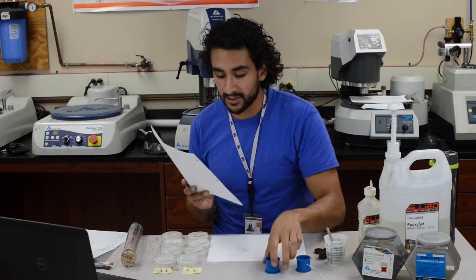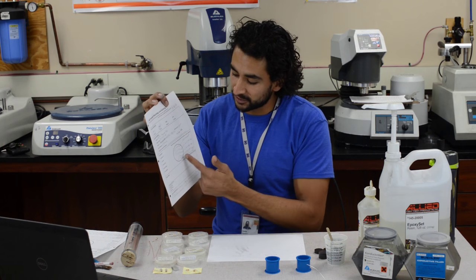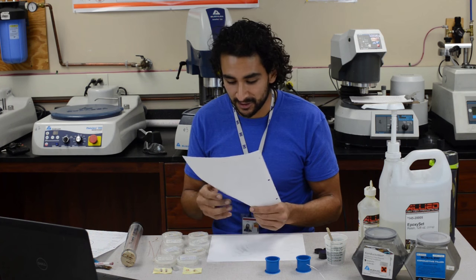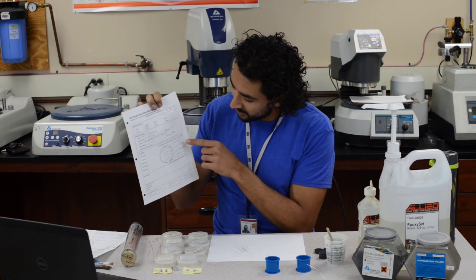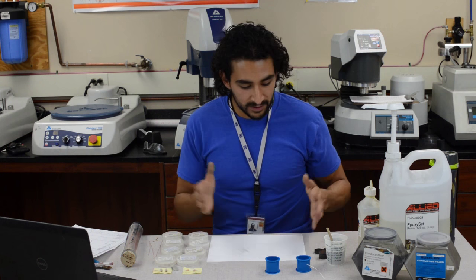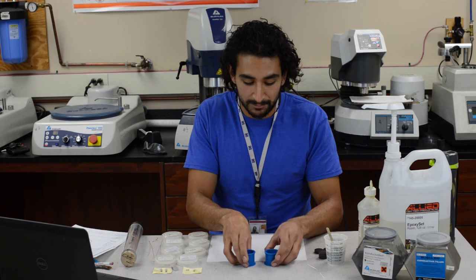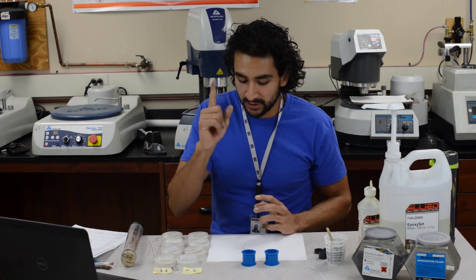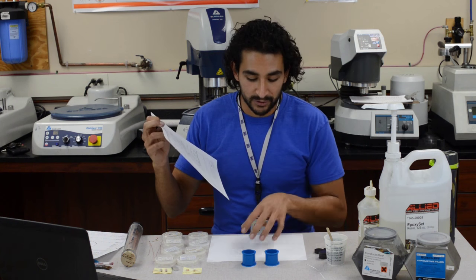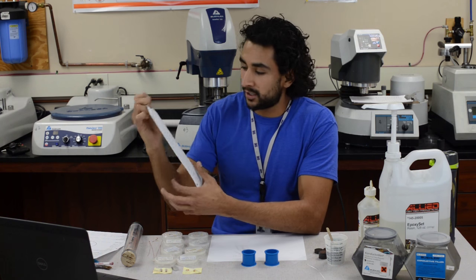Remember, what you're looking at in this diagram is the view from the bottom — the samples are going to be sitting at the bottom of the puck. When you look at the face of the puck, it's going to be a mirrored version of that. In this case there's no problem because I'm going up and down, but if you have left-right orientation of your samples you need to make sure that what's on the right will be on the left once you flip it. In my case I have 600-something, different heat treatments applied to these wires.